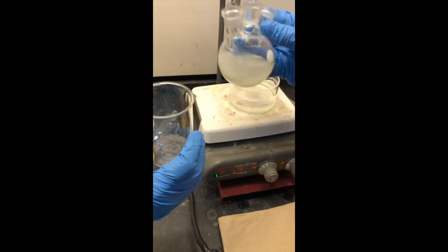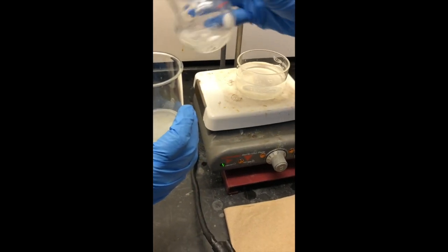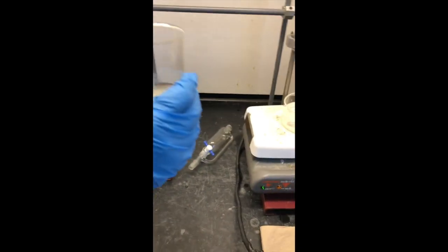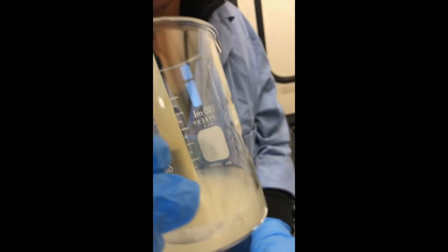We've now disassembled everything and we're going to pour the reaction out into a beaker to see how much leftover magnesium is in this reaction. Then we're going to fish the stirring rod out with our little magic wand — the magnet.